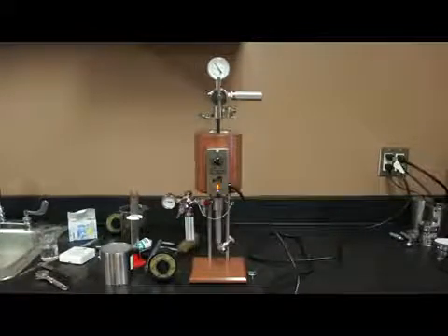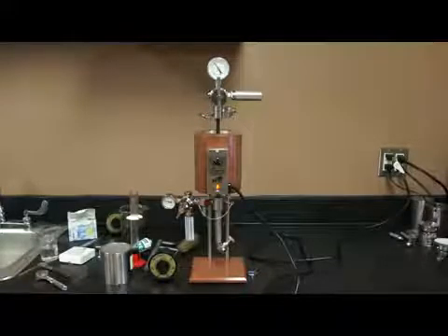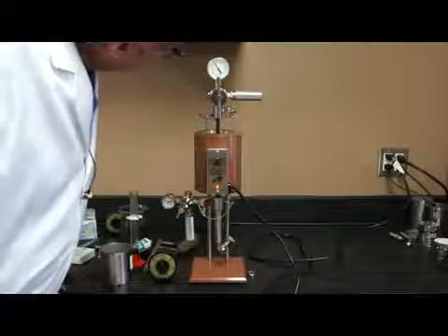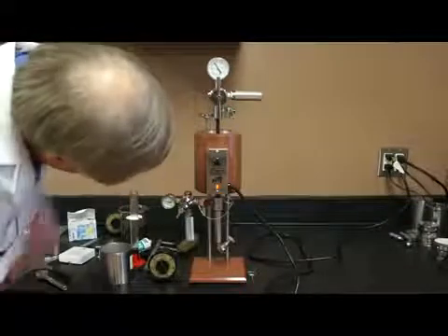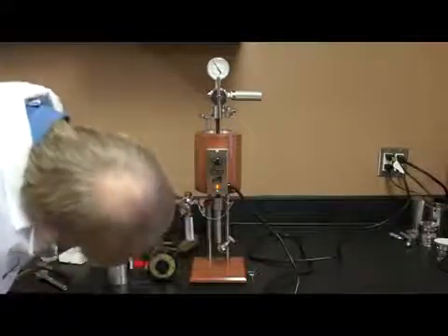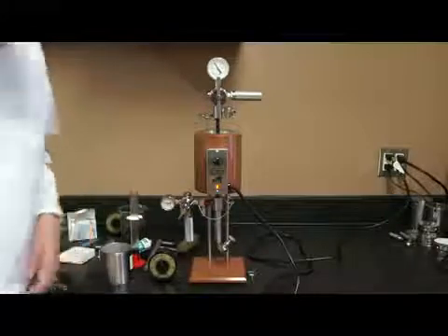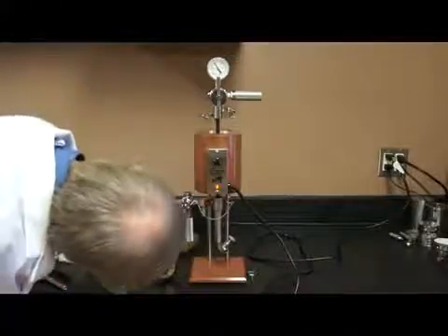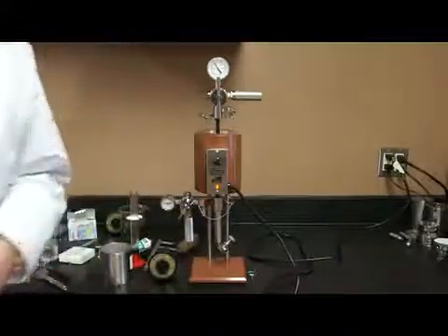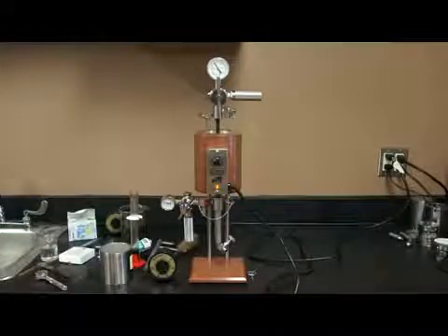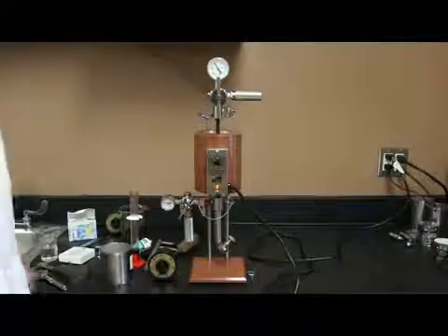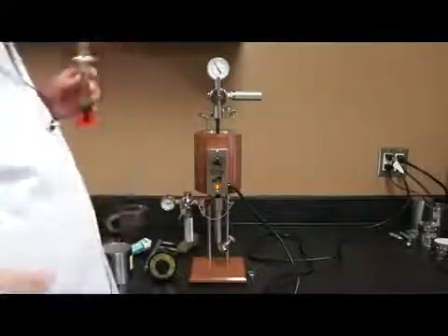I have been collecting filtrate. I've monitored my top pressure assembly. It's staying right at the 600 psi that I put into it. My back pressure receiver is about 104, something like that. So that's certainly well within tolerances.